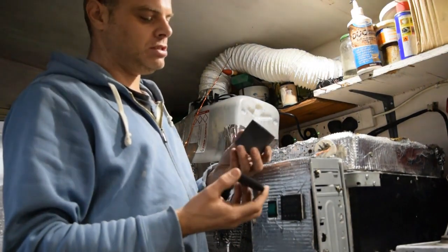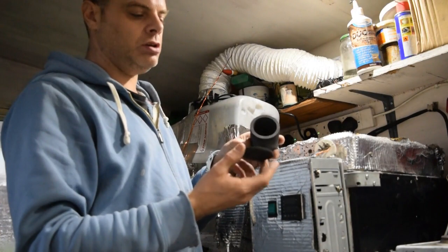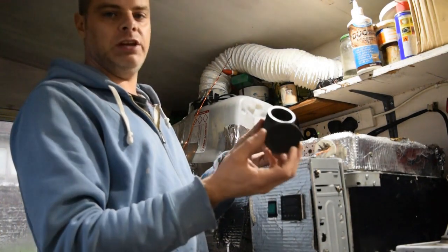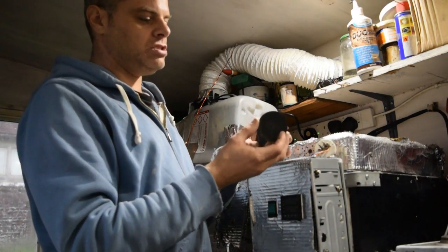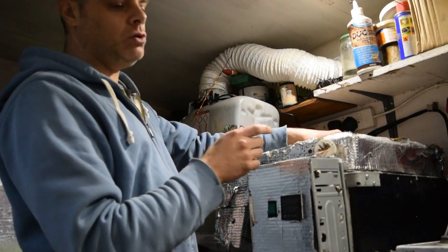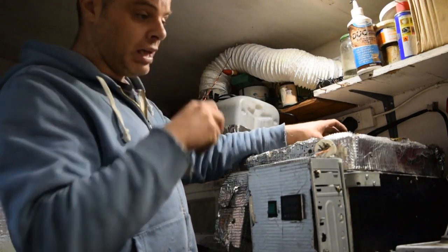What I do is I get one of these crucibles. These are the biggest that I could find from China on eBay that came with a lid. And I put all my carbon in there, put the lid in there, put it inside the bowl, put the lid on, and off we go.